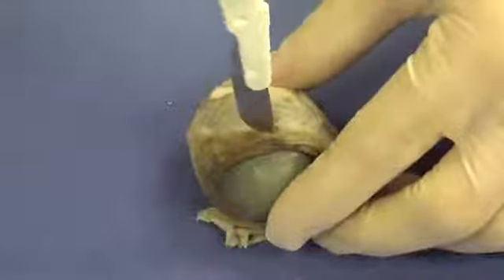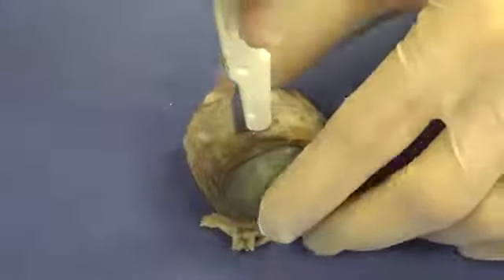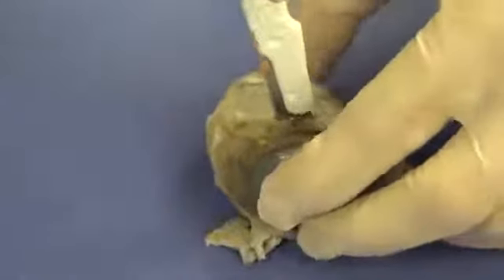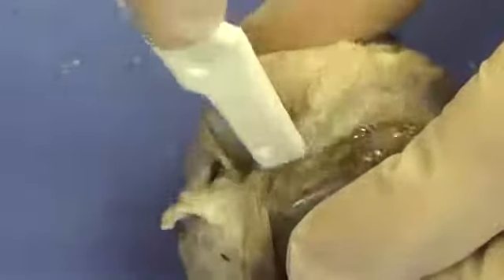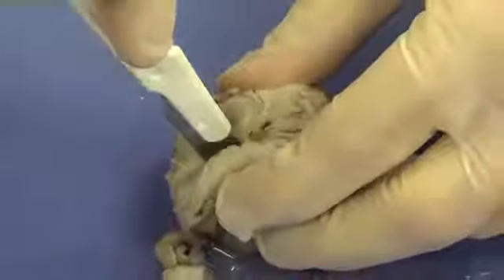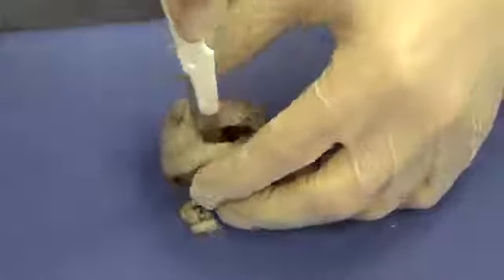So let's go ahead. I'm going to push down gently, straight down. There we go. And you can see some liquid begin to come out. And all I'm going to do is roll the eye and gently cut, gently cut while I'm rolling the eye. Be very careful of your fingers here. If you want, you can use a pair of scissors to also do this. I find it a little bit easier to use a scalpel.